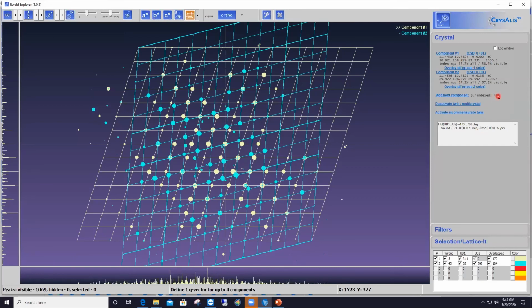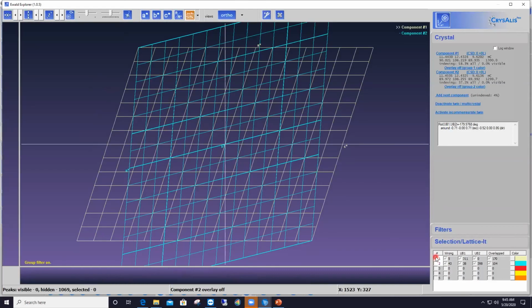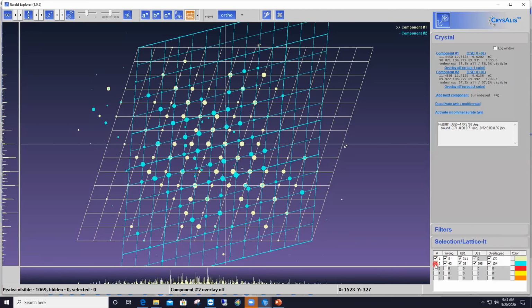And now I've got only 4% of the reflections unindexed. So the first lattice indexed 58% of the reflections, and the second lattice indexed 37%. And now only 4% remain unindexed. The twin law is a 180 degrees rotation along this reciprocal space direction. And that's the end here. I will remove the reflections from the display to better show you the two lattices. And these are the reflections from the first component, and now the reflections from the second component. Okay, so now I've successfully indexed separately the diffraction pattern from both these components. I'm ready to process the data set.